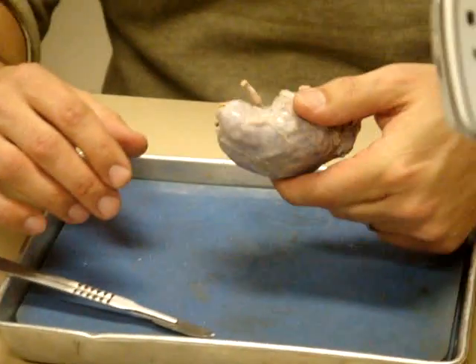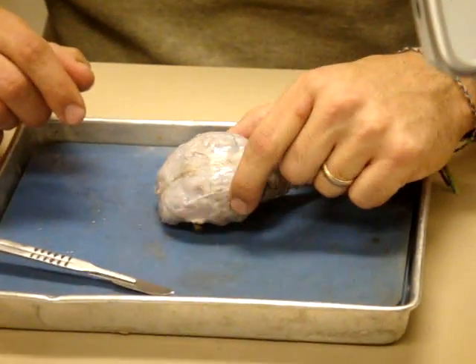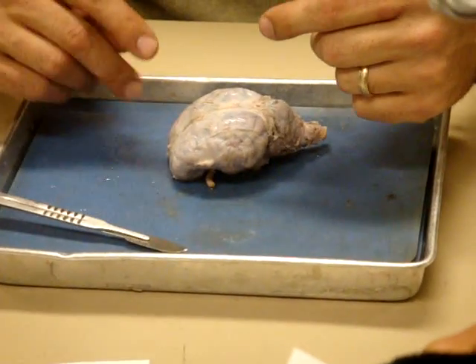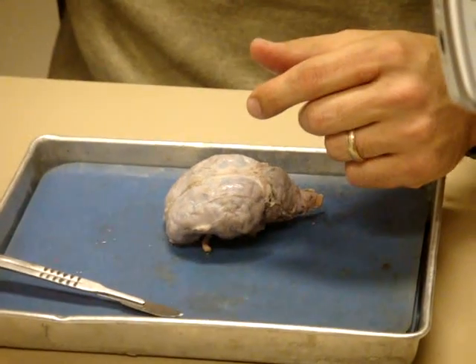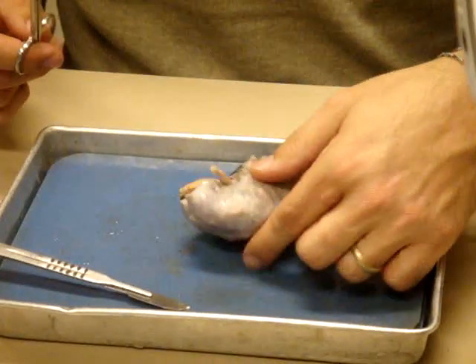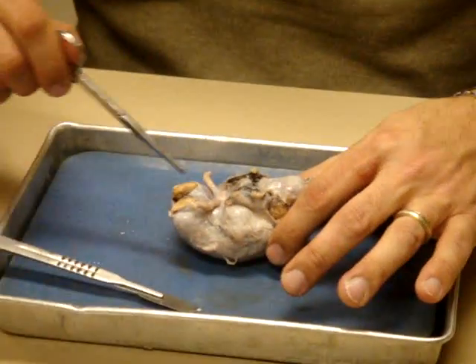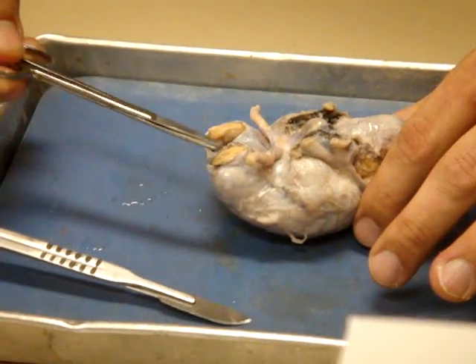So what we're going to do is we want to remove the dura mater here. And I'm going to try to preserve it in a way that we can see those sinuses a little bit. So what we want to do... Oh, let me flip this over. We can see some structures here before I remove this. When we look at the ventral, or in this case, the inferior surface of the brain, we see these two little things right here.